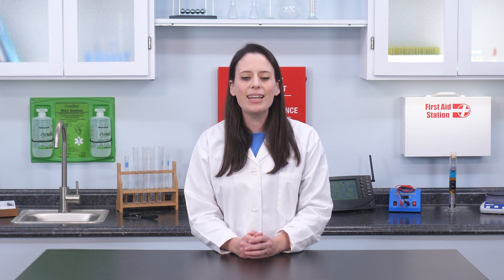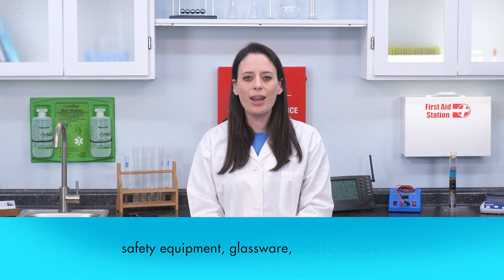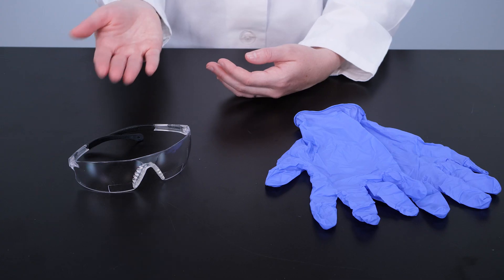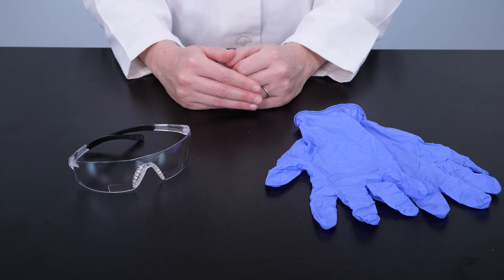To perform an experiment, we need laboratory equipment. Laboratory equipment can be classified in three categories: safety equipment, glassware, and hardware. Safety equipment includes personal protection equipment, such as a lab coat or apron, safety glasses and gloves, and other safety equipment.